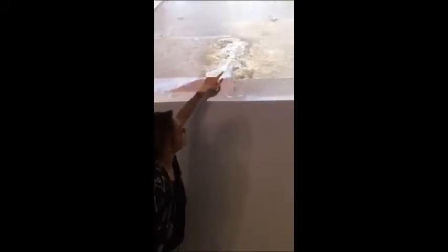Here we're going to compare two zones, which are the welding zone and the non-welding zone, which will be from here to here. In this part, we can see that it is uniform, and in the welding zone it is not. The structure changes, and this is because of the heat that we put, and then we have to let it cool at 25 degrees. And this will be the fusion zone and the heat affected zone.